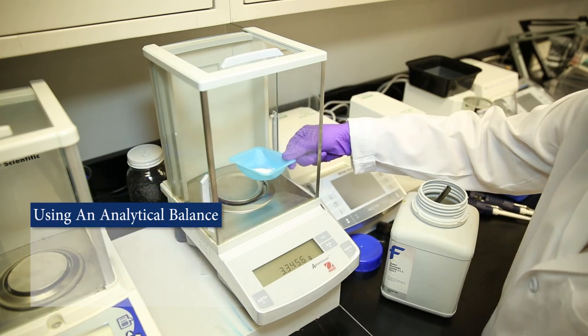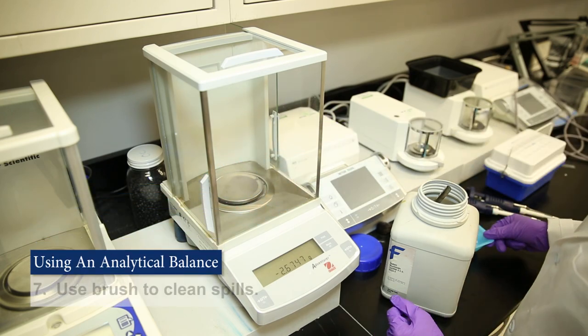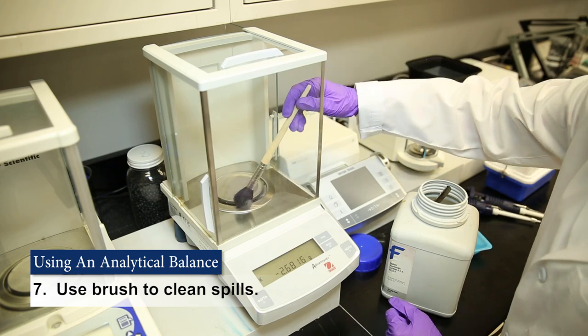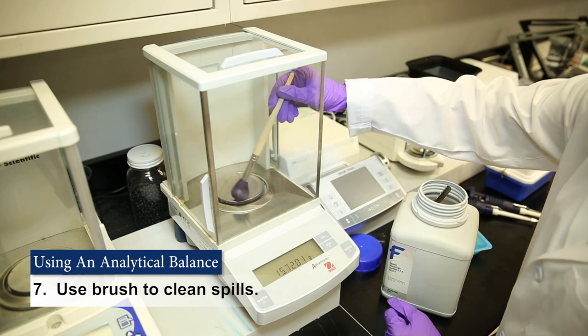Remove your material. And the last step is to clean the pan and the balance with a brush.